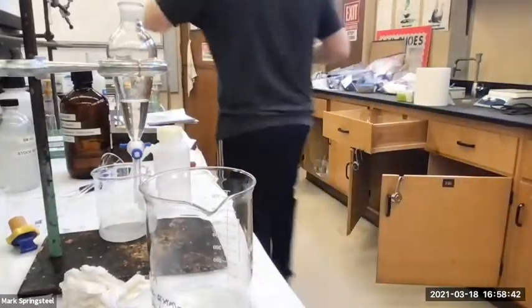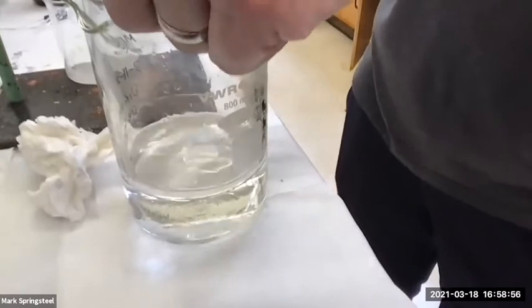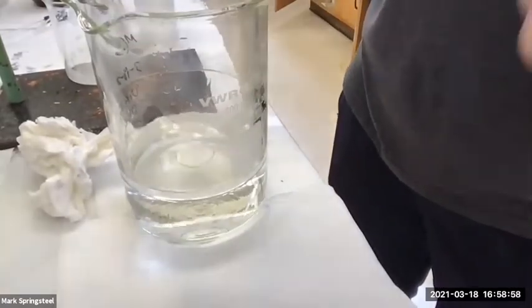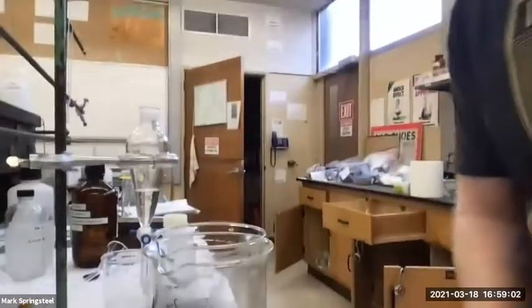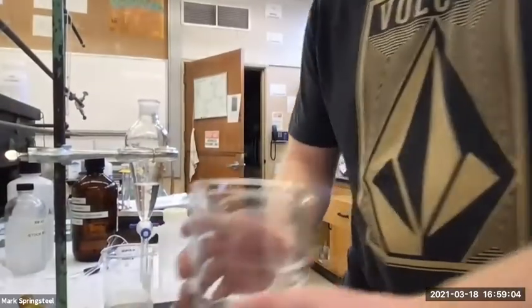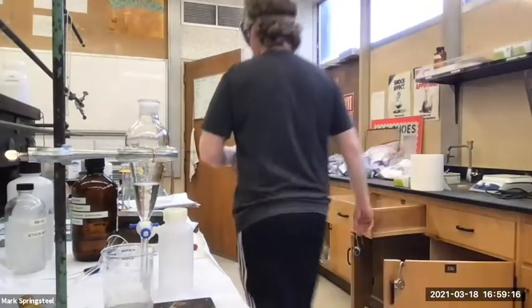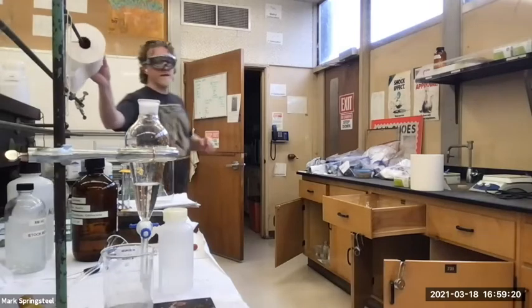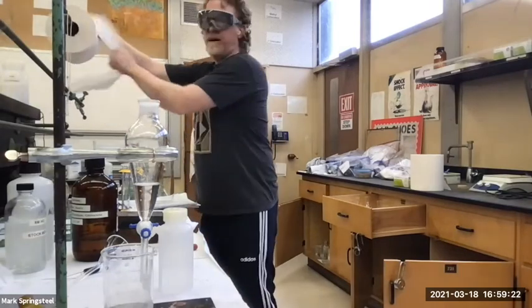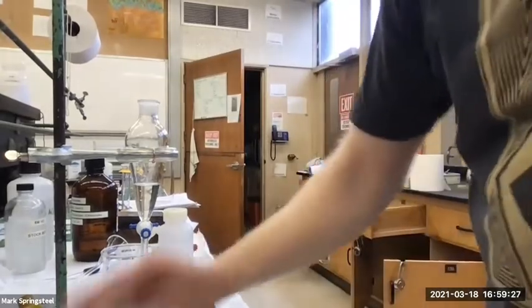Get some warm water in there. There we go, that's looking pretty good. And then I will put that in the fume hood as well. That'll speed things up. I'll walk that over. And while I'm letting that dry or evaporate, I can work on my aqueous layer. And also, I want to fill in my extraction diagram because I haven't written everything in that we've done so far. Let's catch up on that.